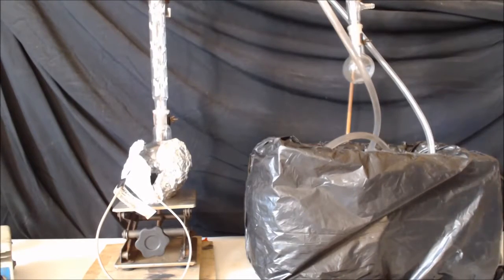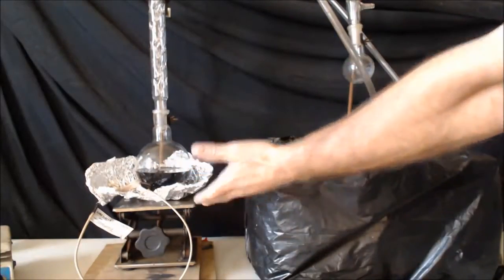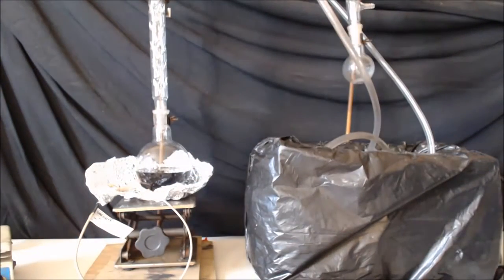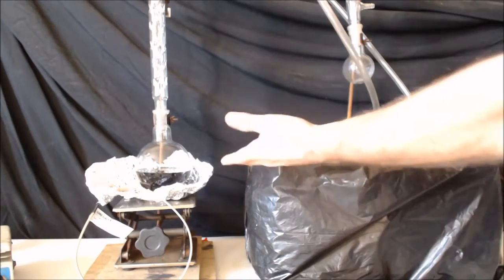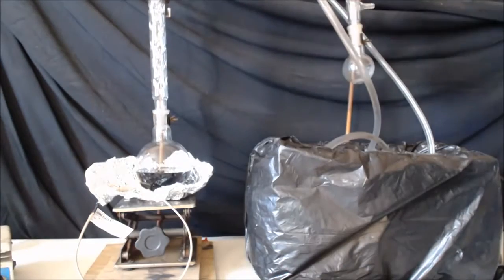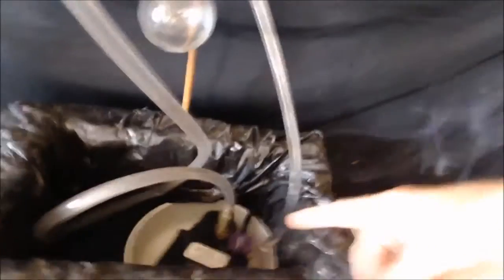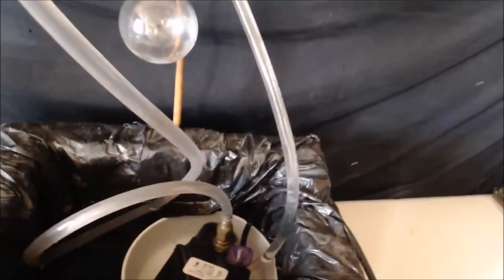Alright I'm going to go downstairs and do this, but I'm going to show you the gist. I got my hot plate, although downstairs I got gas so it'll be cheap, almost free. I can distill that up, it's going to go up this vigreux column, and I got a condenser here, my thermometer comes back down, I'll collect it in here. And obviously there's my pump for my water condenser.